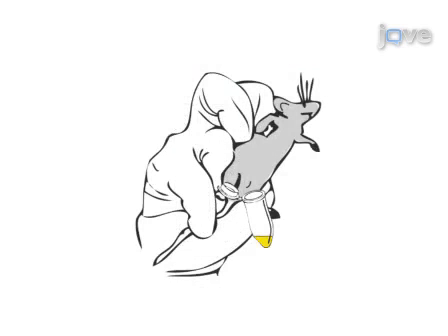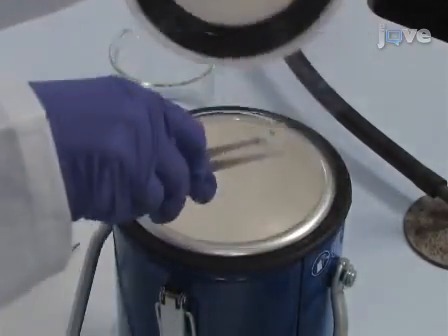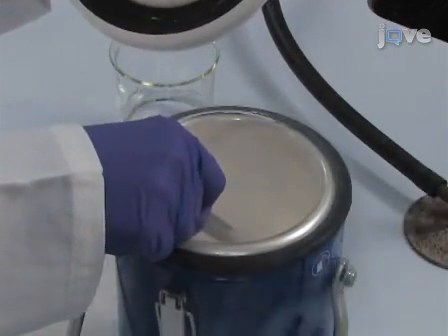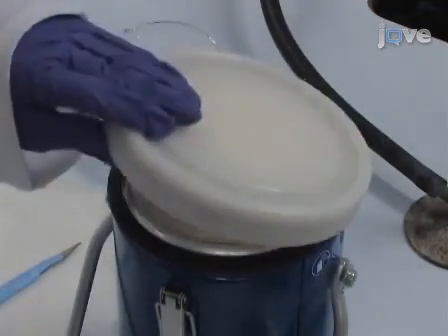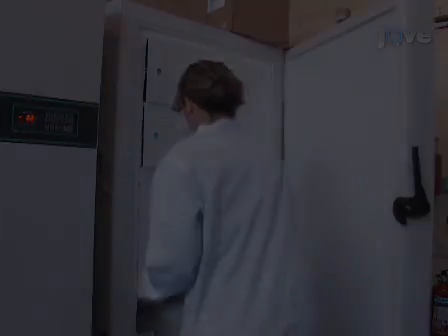Collect urine in a 1.5 ml microtube by handling the mouse over the tube and help micturition by gently massaging the bowel. A minimum of 20 microliters is required for acquisition with a 5 mm NMR probe, but it is recommended to use 30 microliters to improve the quality of metabolic profiling. Snap freeze the urine immediately in liquid nitrogen.